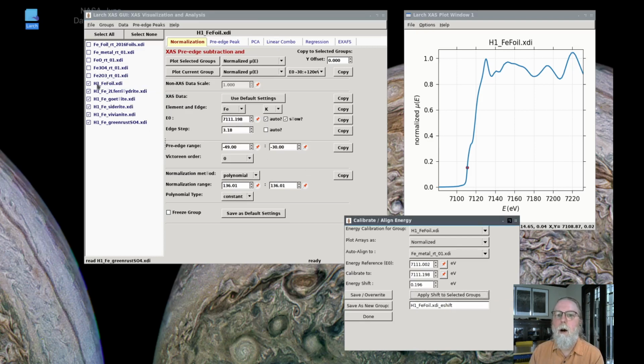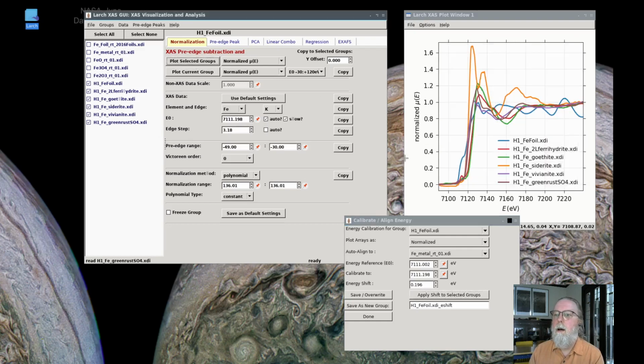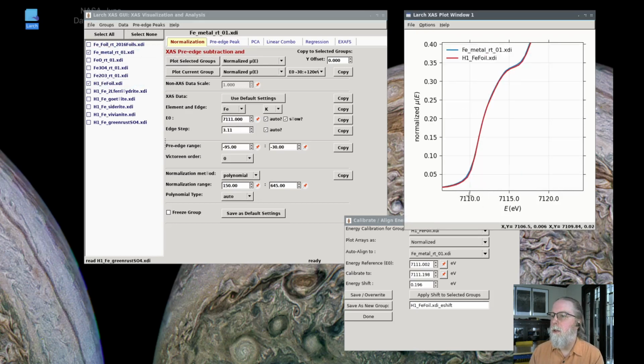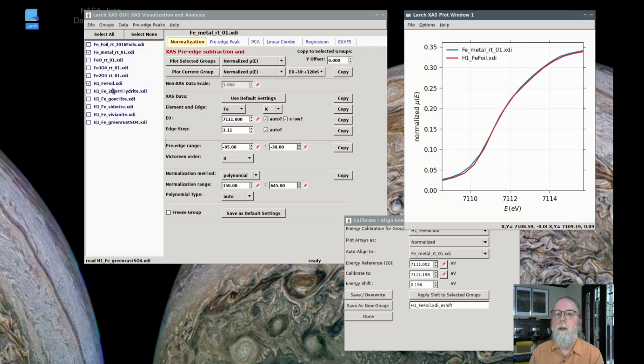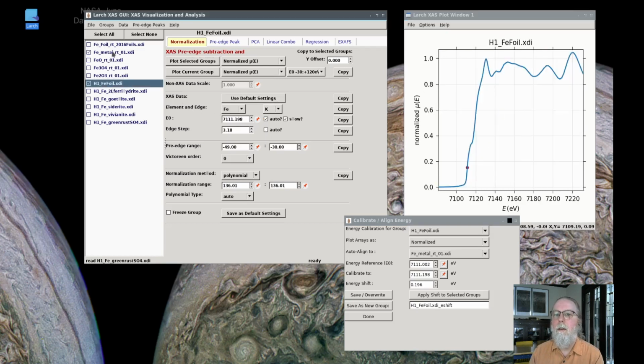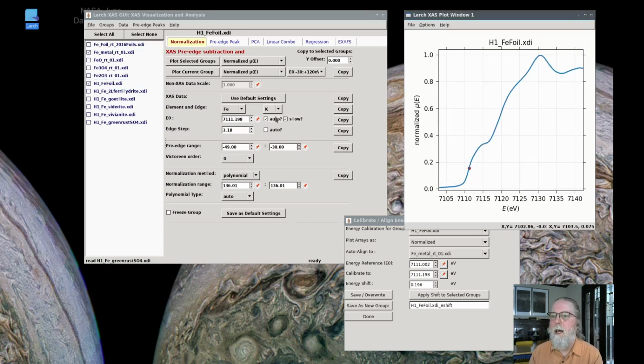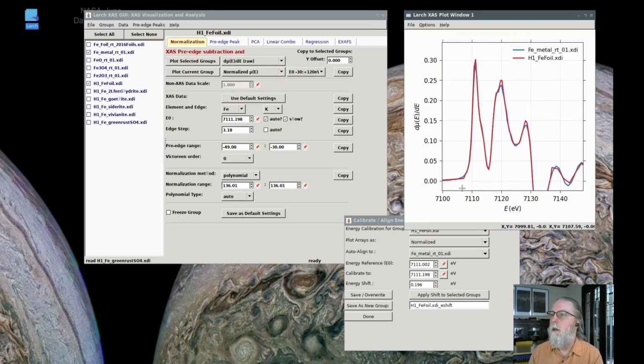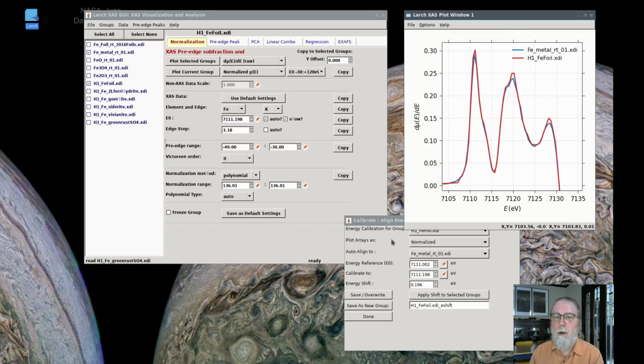Apply that, and now all of these are aligned together. They all have the same energy alignment, and if I select this one and the one we aligned to and plot those together, then those are still really well calibrated to one another, and the energy shift is very close to each other. The energy in the alignment is very close. If I plot those two as derivative, you'll see how close they really are in that range. So those match very well. So that's how you do energy alignment from one spectra to the next.